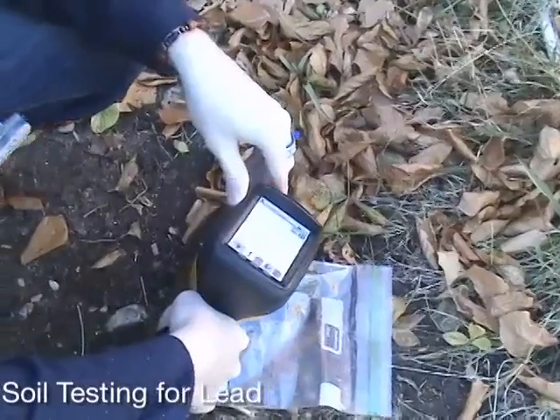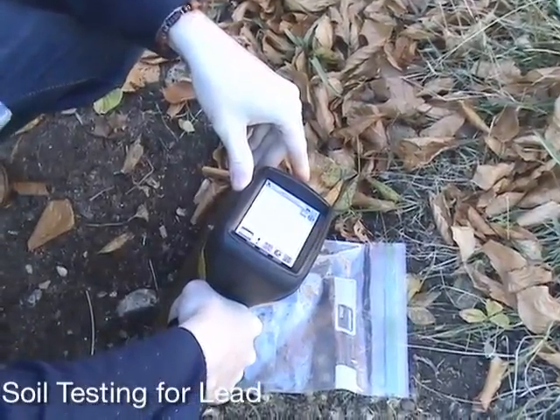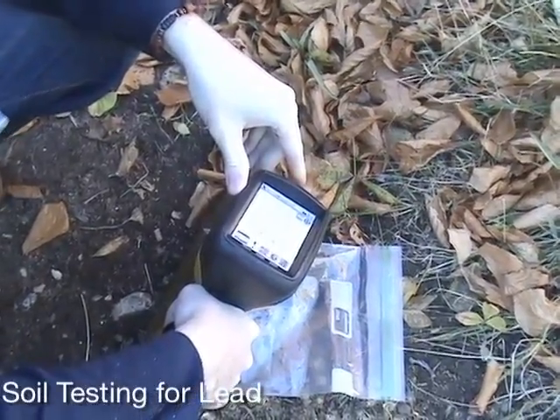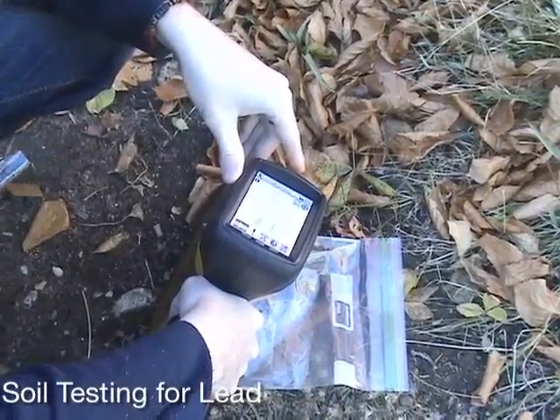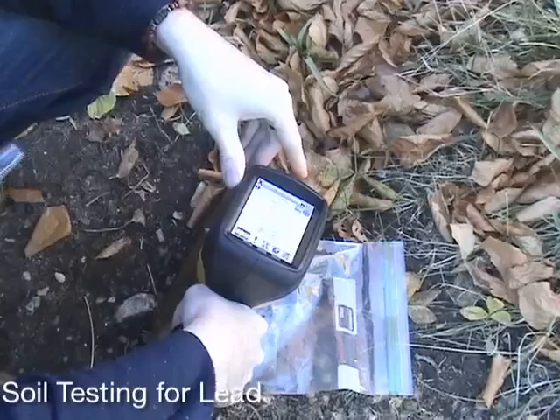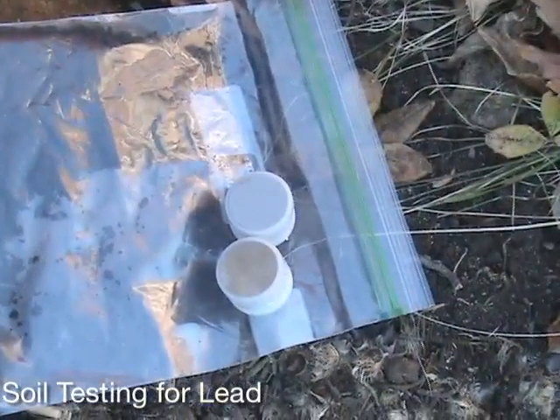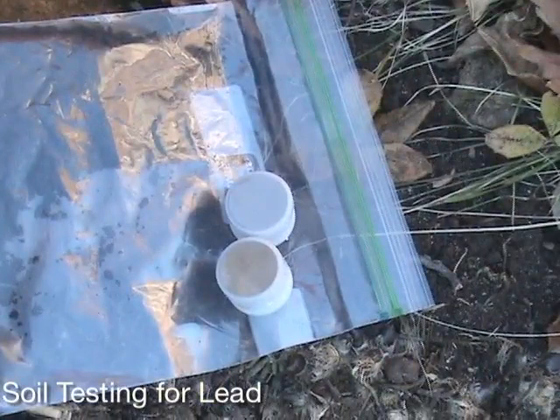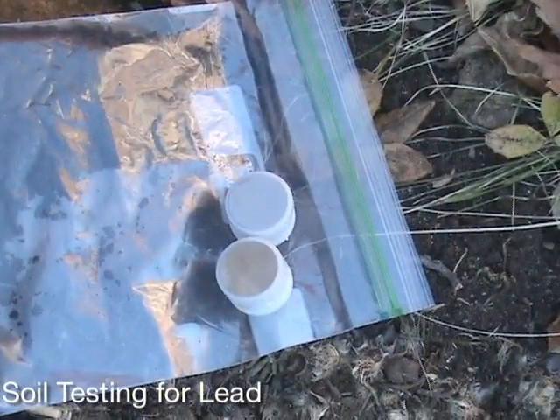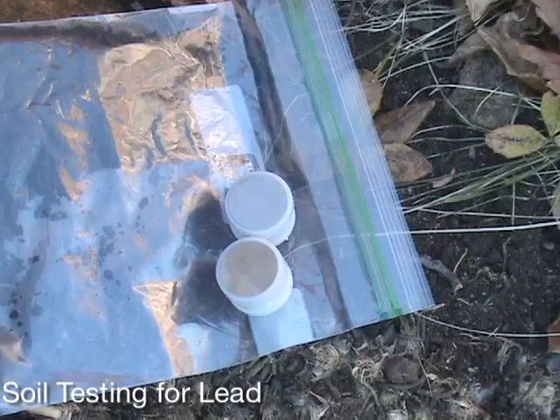In this case, the reading of the bagged soil is about 1,000 parts per million lead, which is in good agreement with the simple surface measurement previously taken. To follow EPA Method 6200 for field measurement of metals in soil, one should also take some of the mixture in the baggie and prepare it for lab analysis.